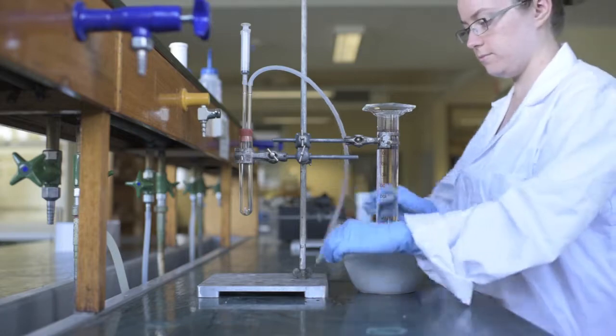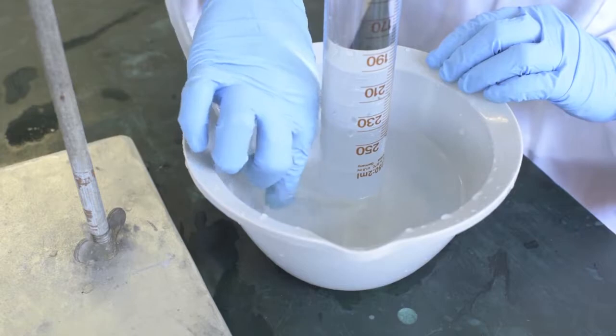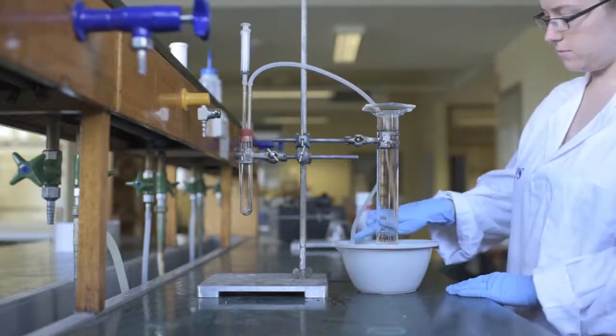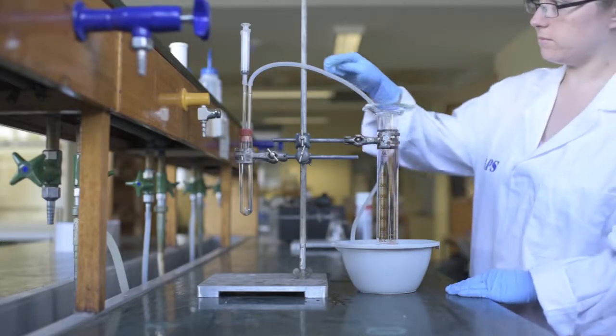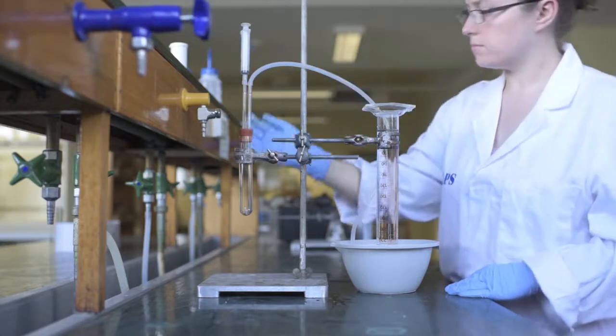Secure the cylinder with a retort stand, leaving enough gap to feed the end of tubing under the rim of the cylinder. This is where hydrogen gas will travel along from a test tube that a 10 ml syringe of acid should be connected to, for reaction with the metal in the test tube.